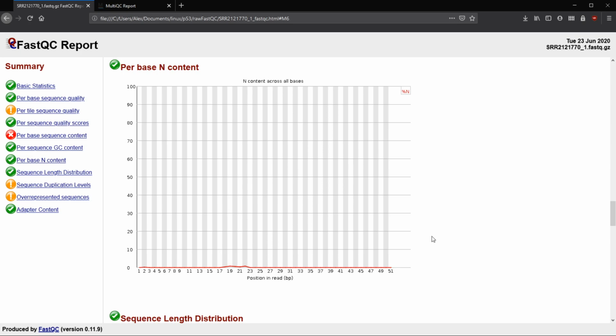But this is where the sequencer cannot appropriately determine what that base is, so it'll just say N. There was a base here, but there's too much noise, or we just don't know what that base actually is. For this, a warning happens when the percentage of N's at any position is high. So here we have slight N content, but at any position, if the N content is greater than 5%, we're going to get a warning.